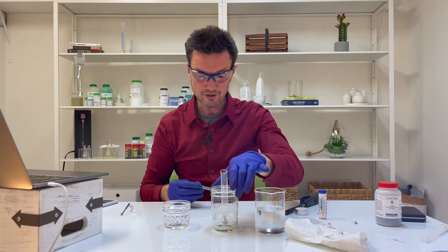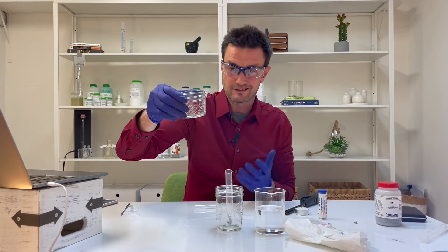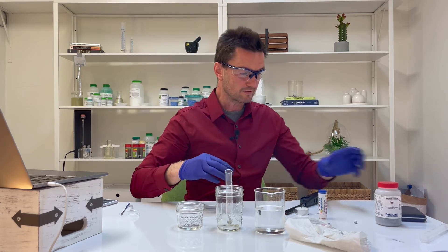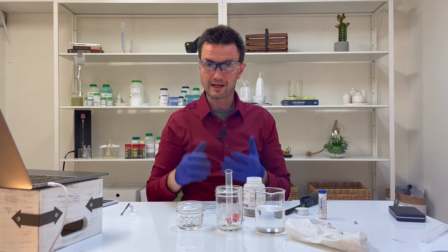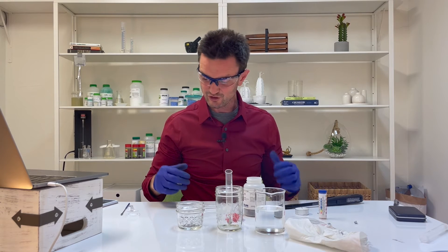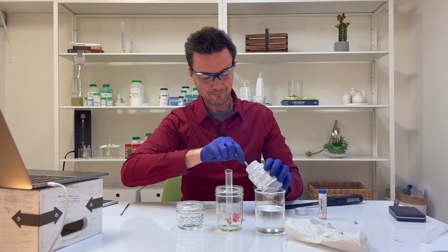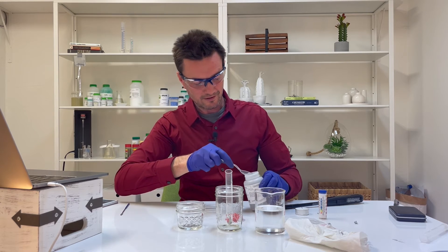For calcium, it will require a slightly different procedure. Use a cup — a Dixie cup, a glass, or a beaker. You're going to need about 50 milliliters of water and one piece of calcium. Do not let calcium touch your skin — again, these are subtle hints about what might be more or less reactive between calcium and magnesium.